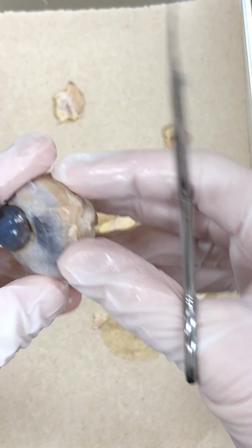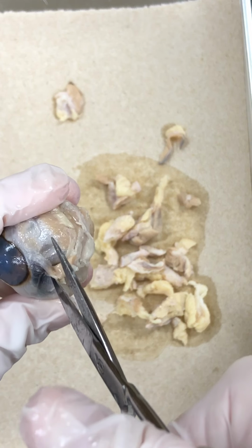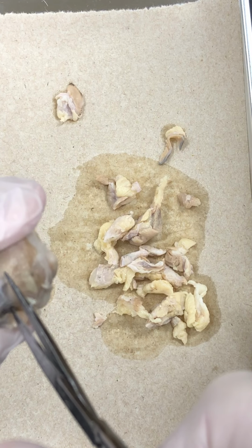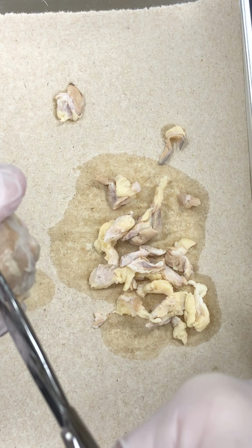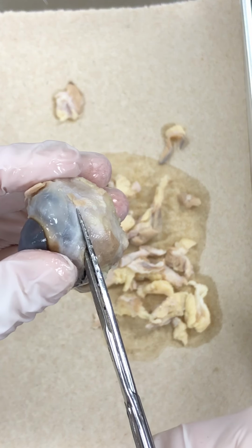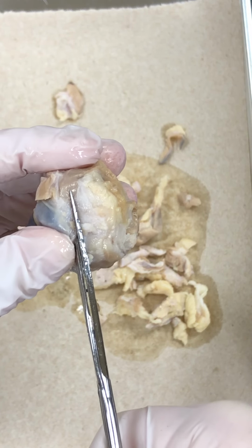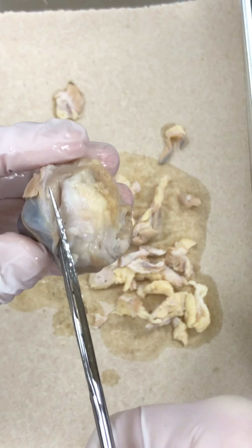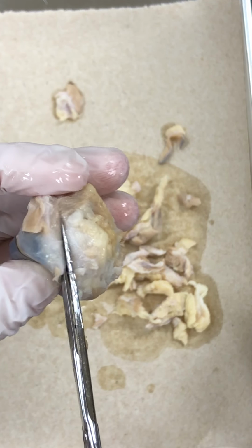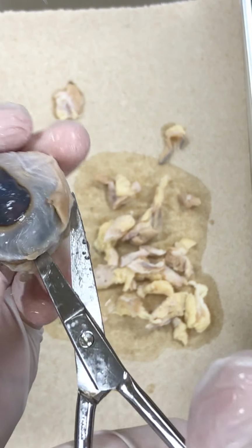Okay, to cut into this, we're going to try to separate anterior from posterior eye. So we are going to cut this way. Some fluid will probably come out. I don't know if you can see that fluid coming out. That's probably going to be the aqueous humor. It's dripping down. I don't know if you can see it, but anyway, that's the aqueous humor, and that's going to help to give the eye structure. It's going to help to keep the shape of the eye a nice rounded sphere.